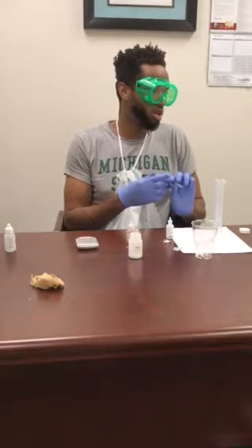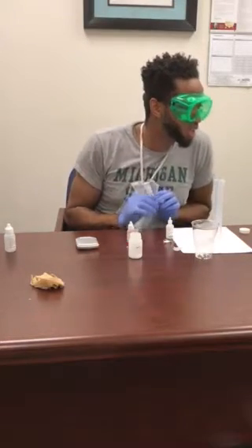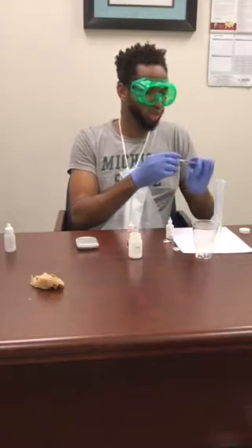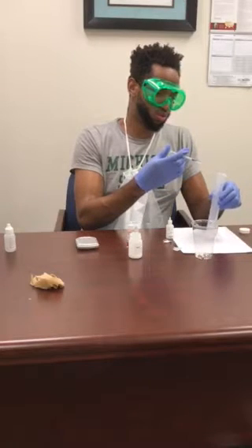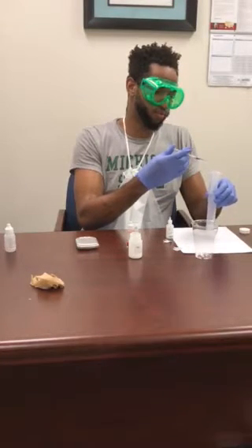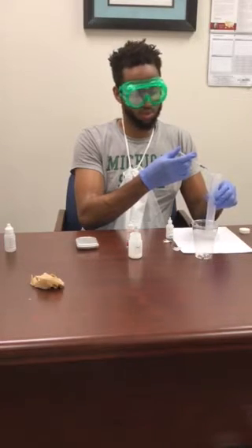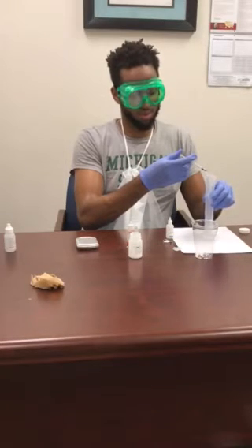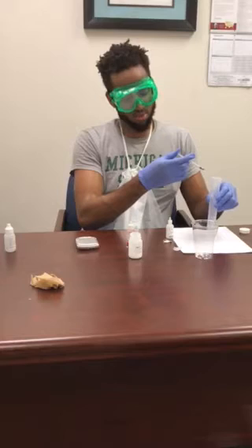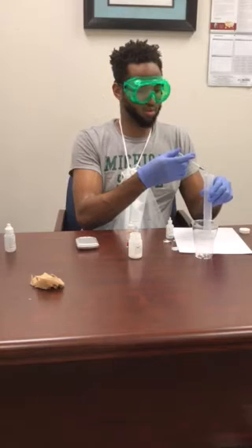Now, are we supposed to add the stuff there into the flask and then do the... It doesn't say. Okay. Yeah, it just says add this to here. Okay, yeah, go ahead and do it constantly until you get the change of the color. Oh, okay, I see what it is. See a little bit. Yeah, it's getting a tad bit yellow. You see that? Mm-hmm. Yeah.